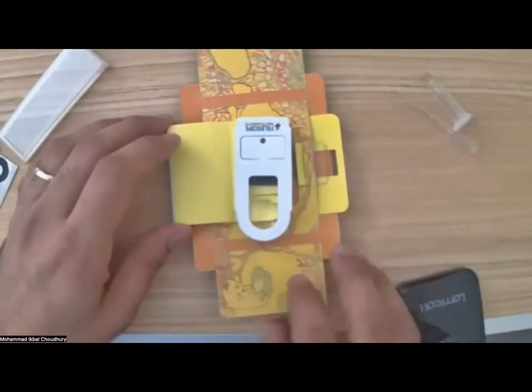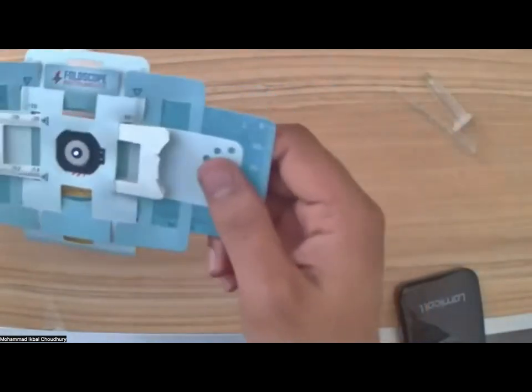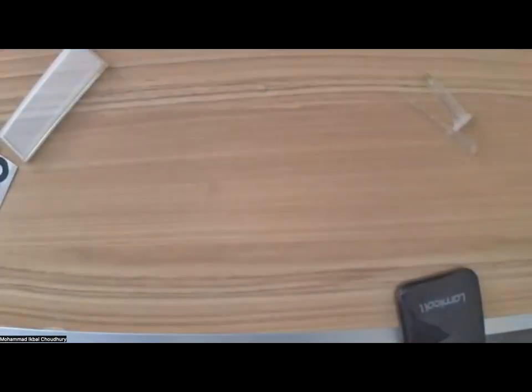I'll take my light source, place it there, and I just wanted to see with my eyes what's going on, if I can see something, because it's easier to spot something like that instead of connecting your camera. I do see a bunch of stuff, green things, but I'm not really sure what they are.